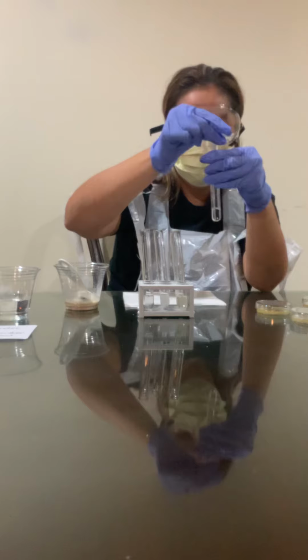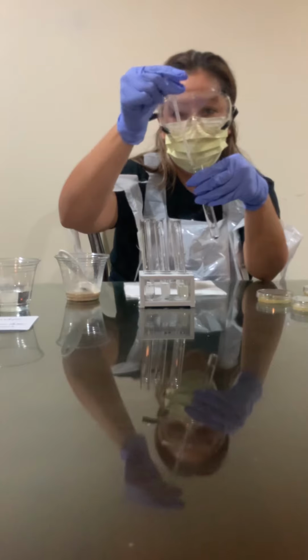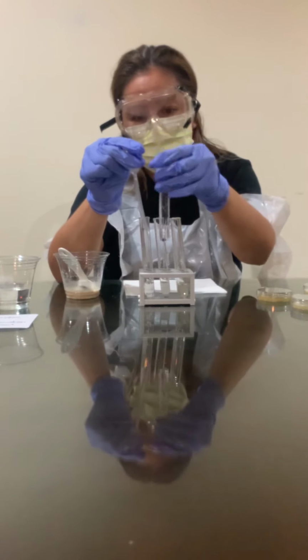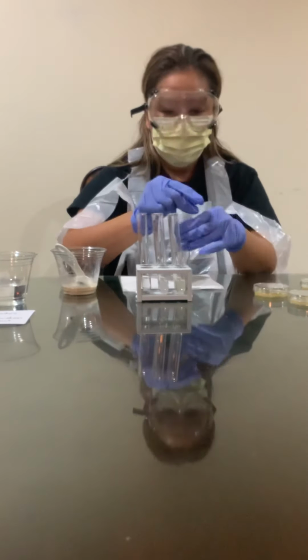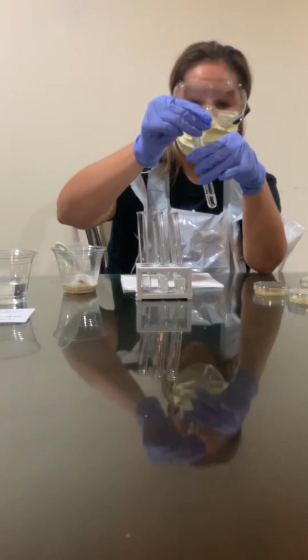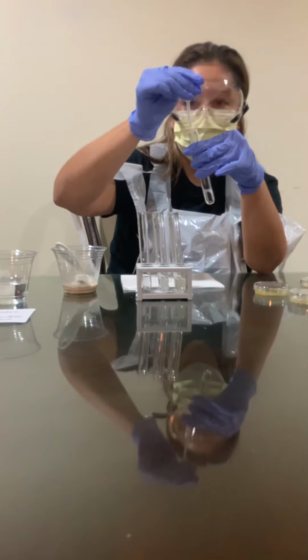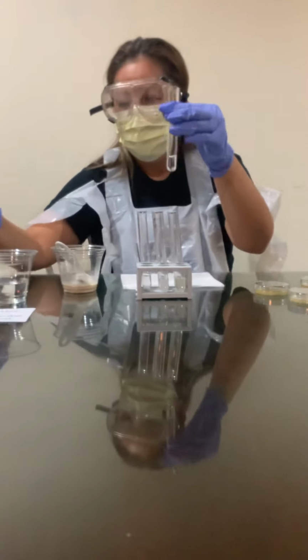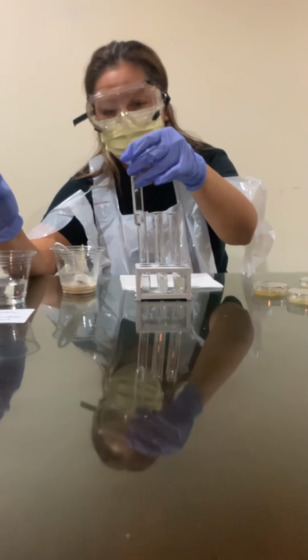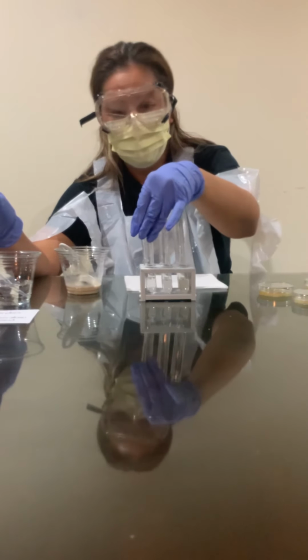And again, obtaining 0.25. And finally mixing it into my test tube number 6. Now that I have done this, same thing, make sure that all of it is out. And now I'm gonna rinse this with water. Okay, test tubes are done. So I've already diluted that solution.